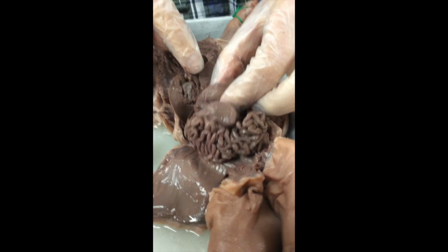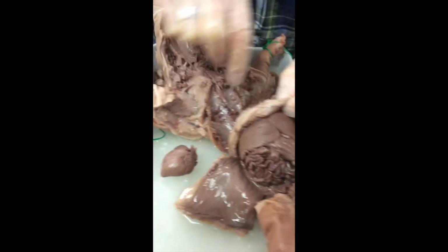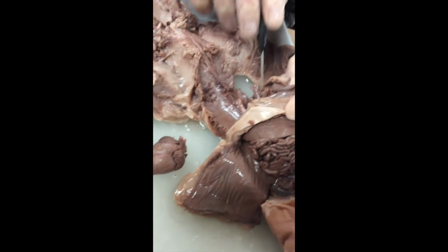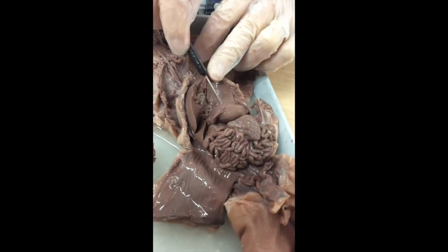We have a bag right here. It's kind of squishy. It's filled with fluid. There's the stomach. So our esophagus, right here, there's the remnant of the esophagus. I cut it, as it's extended up here. That esophagus goes through the diaphragm, and it's attaching into that stomach.